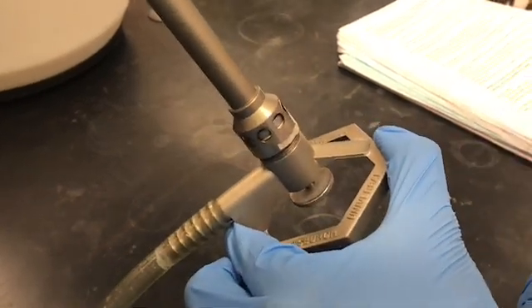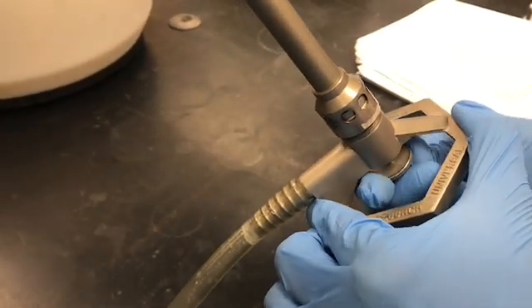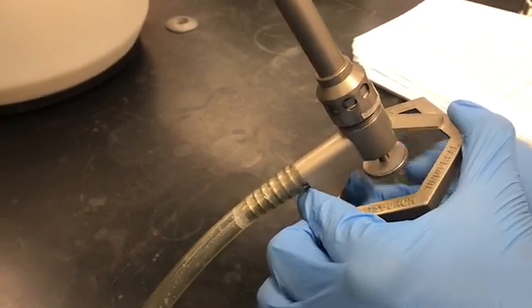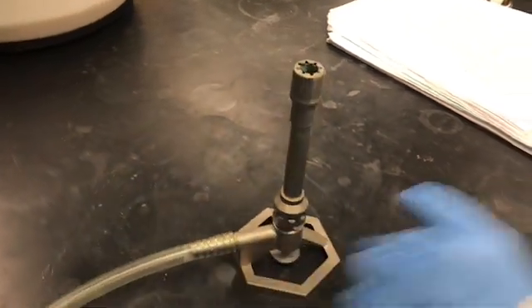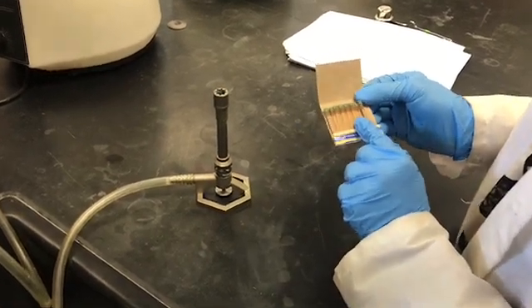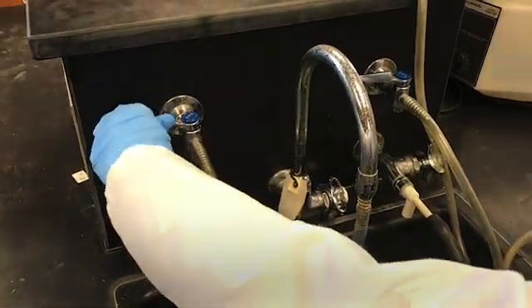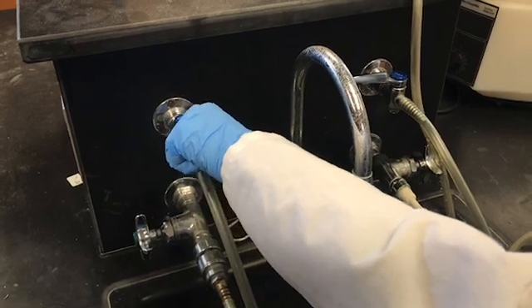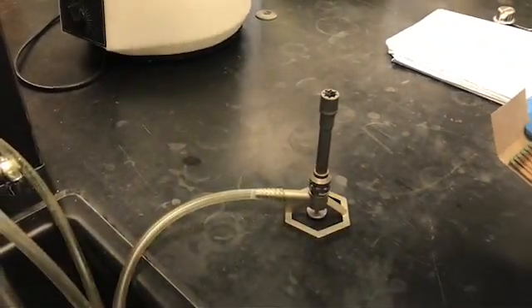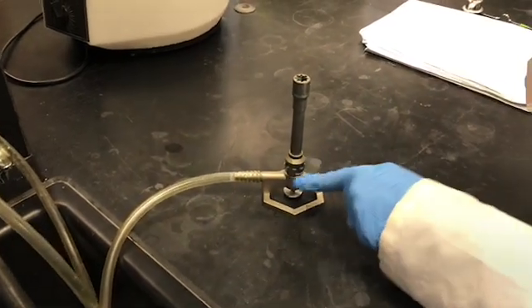Give four full turns to the needle valve the same way as the barrel: one, two, three, four. Now I'm going to light the Bunsen burner with the matchstick. I'm going to turn on the main gas valve 90 degrees from its current position. You should hear a hiss sound, which means gas is coming from the main gas valve through the pipe and the gas needle valve, mixing with oxygen.